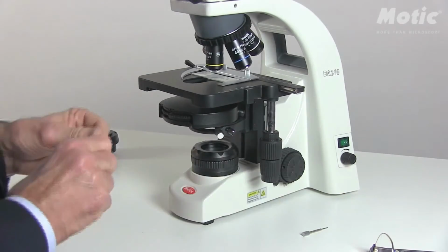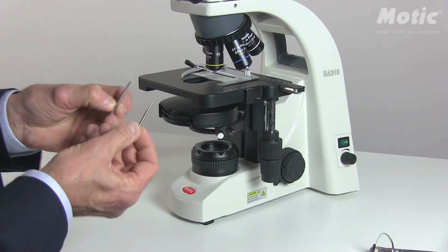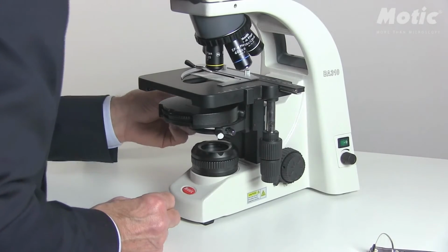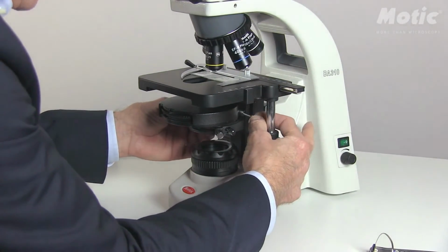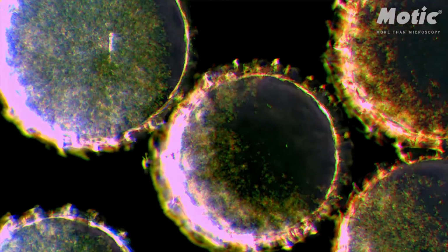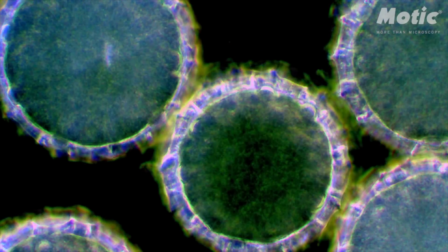Again, for the final setup, use those Allen keys. The centering screws are accessible from the back side of the condenser disc, from the left and from the right. Again, rotate and push the disc to the point where all those tiny little structures have a bright and homogeneous surrounding. Remove the Allen keys. Dark field is set up.